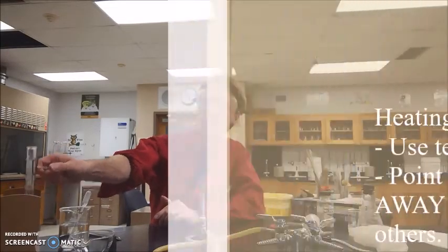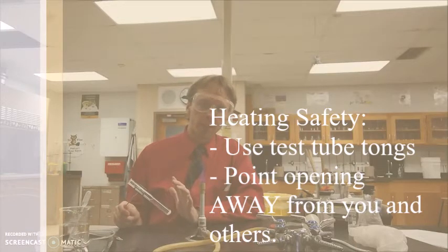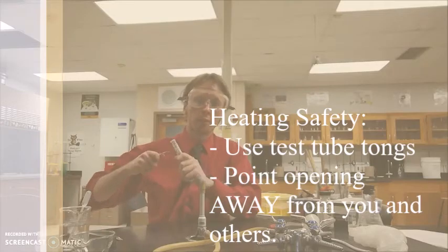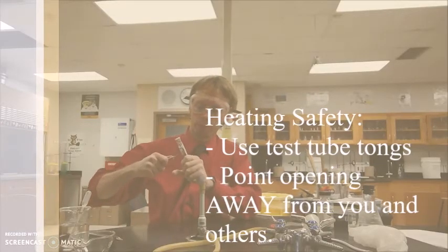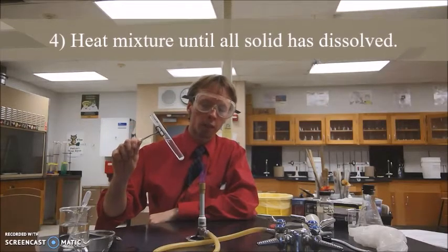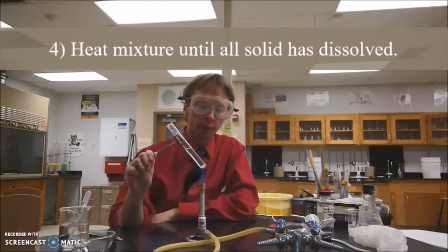When you're heating liquids in the lab, it's important that you have the opening of the container pointed away from you on the chance that it might splash, and you want it not to go into your face or onto your clothes. Also, when you're heating things, you want to make sure that you're far enough away from the thing that you're heating. So I'm going to use these little test tube holders, and I'm going to hold it at the end, and I'm going to put the bottom of my test tube into the hottest part of the flame, which is at the top of the inner blue cone, and we're going to keep it in there until the sodium sulfate has completely dissolved.